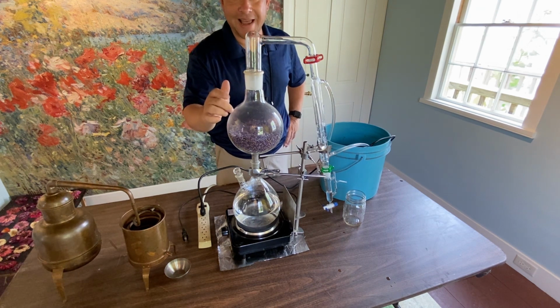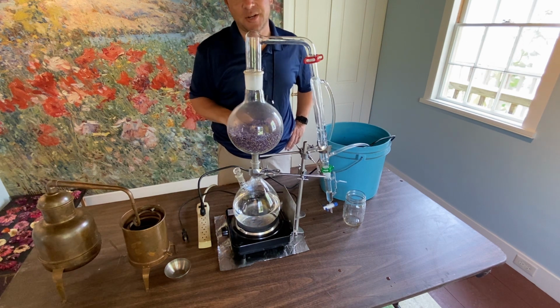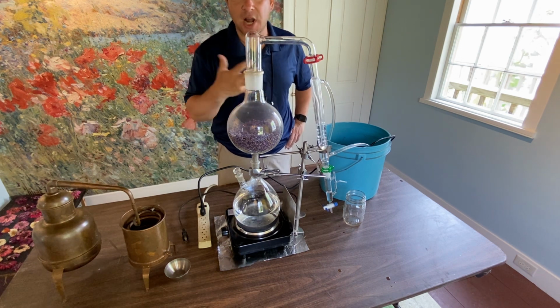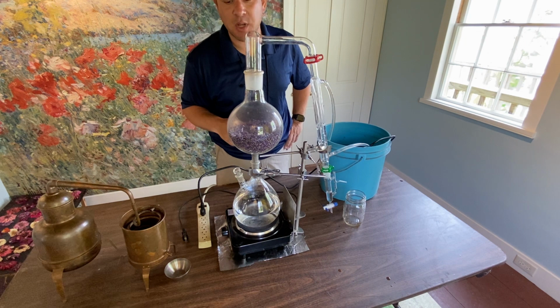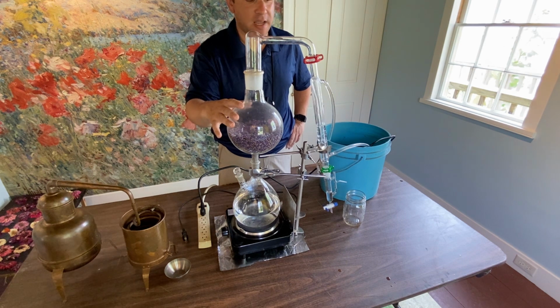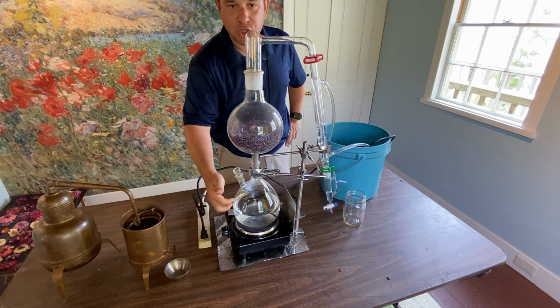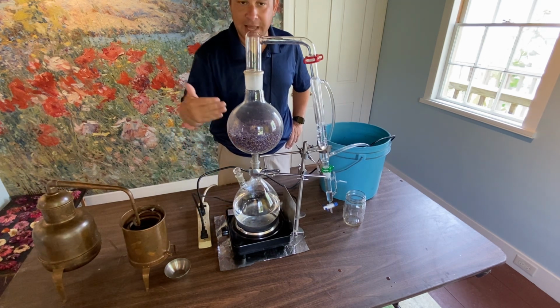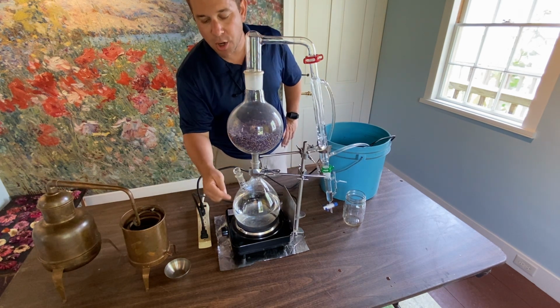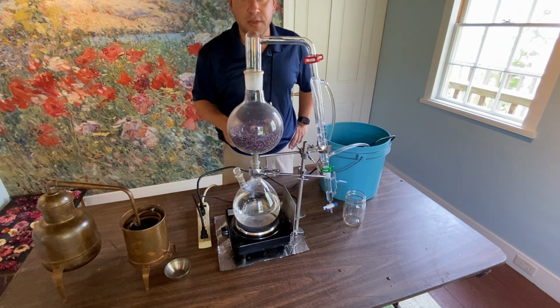Now borosilicate glass, often called Pyrex, associated with kitchenware, was invented in the 19th century by a German chemist. And this type of glass really made it easy to do extractions and different experiments within labs because of high heat. Very strong glass, high heat, no problem, easy to take care of. I'm actually going to start simmering the solvent, which is water today. This gets a lot trickier with other solvents, but with steam distillation, it is literally just distilled water and any plant you're trying to extract from. Today, it is lavender, as you see within the flask here.